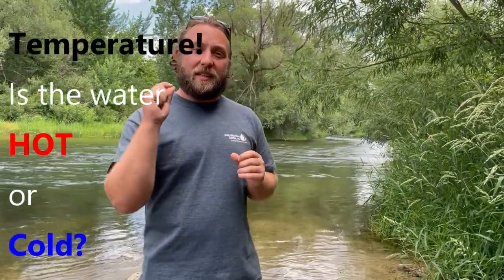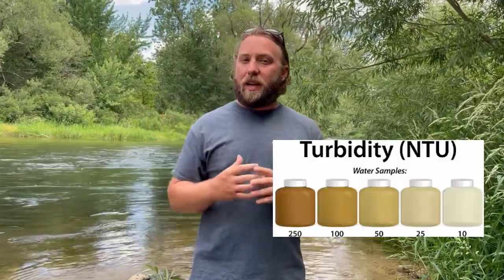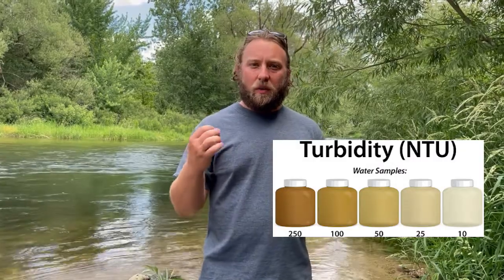Hey Watershed Watch participants, we're going to test some physical parameters of the Boise River. Physical parameters are incredibly important for us understanding the health of the river. When we test physical parameters, we test things like temperature, so how hot and cold the river is. We test the turbidity, or how clear the water is. We can also test how wide the river is and how fast the river is flowing. We're going to ask you to do all of these tests during Watershed Watch.